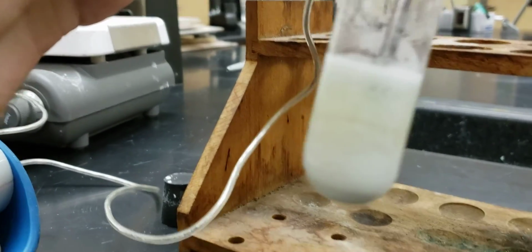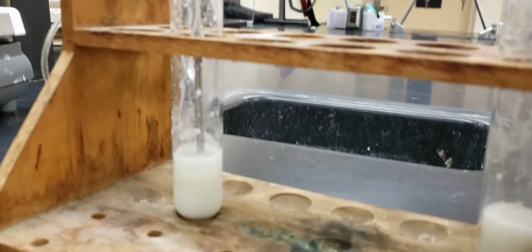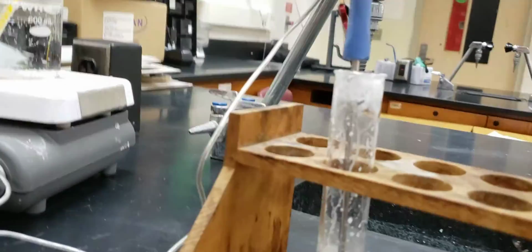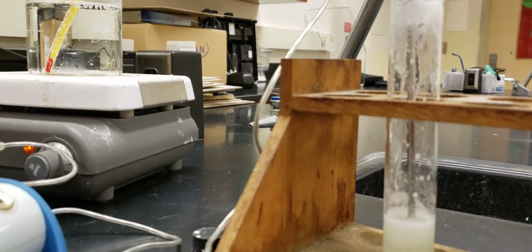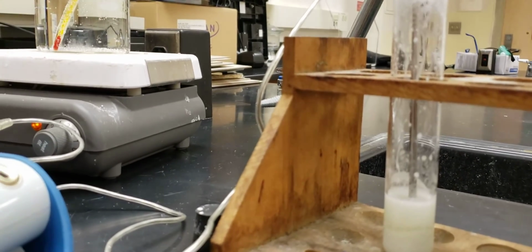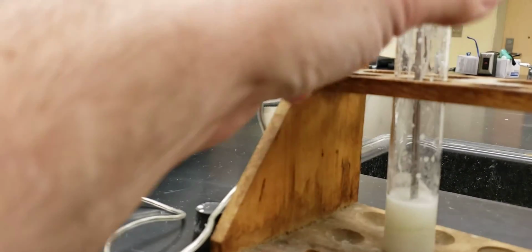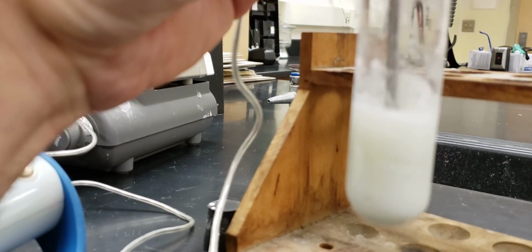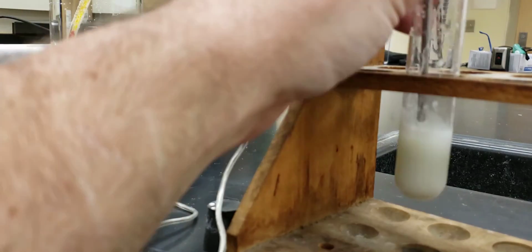Now we pull it back up. Okay, minor disaster. Minor disaster. All right, and not the worst. We survived. Notice that at this point, it's getting to the point we can hardly even move the thing around. And that's okay. That's what it's supposed to do.